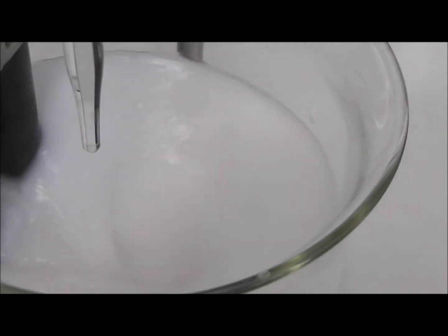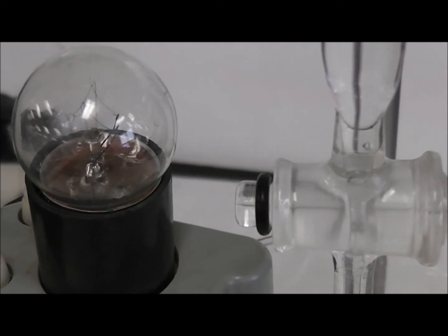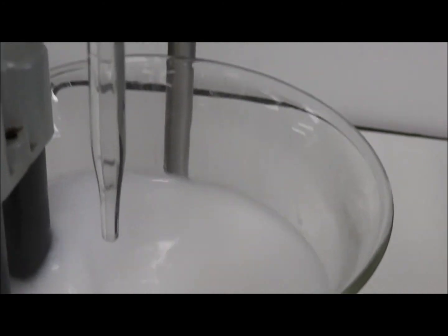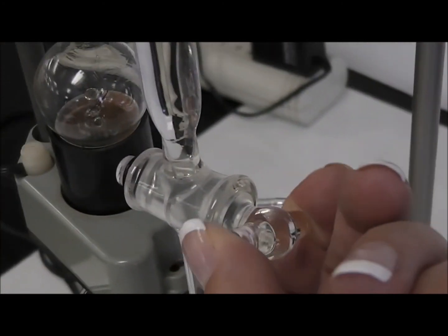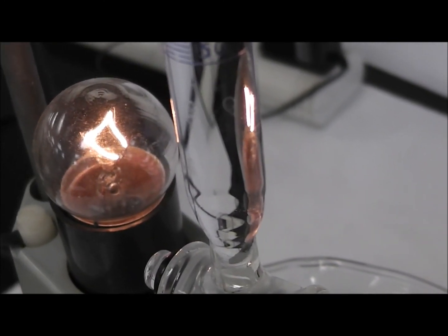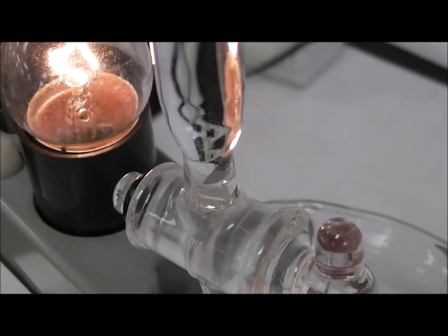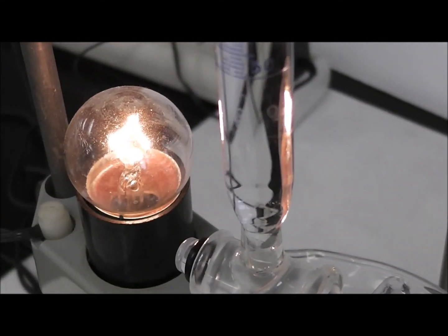This is pure barium sulfate in water. And if I filtered it, I would be able to dry it and have barium sulfate crystals and nothing but liquid water. And now I'm going to go a little bit over. I'm going to go excess now. Put in some excess acid. And I'm going to make the light come back on. There it is. Light's coming back on because sulfuric acid forms ions. And I've got ions again in the solution.